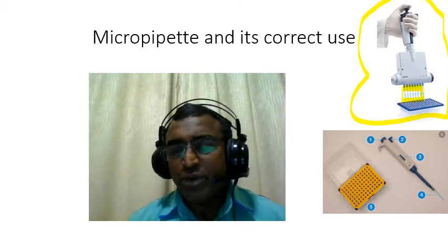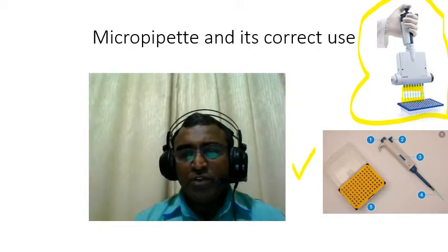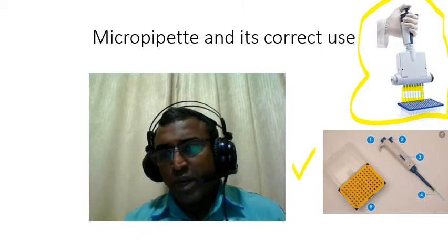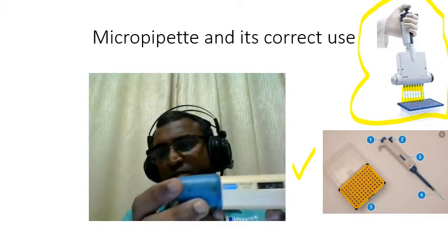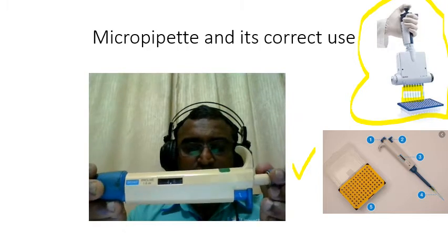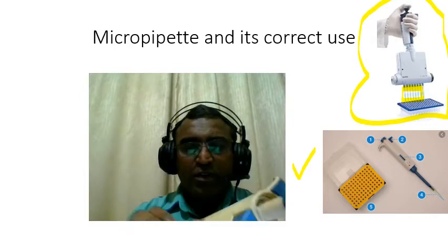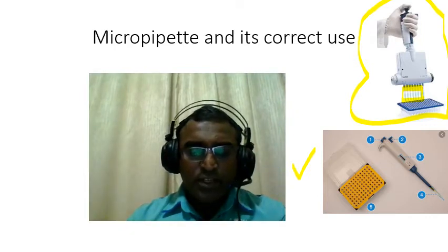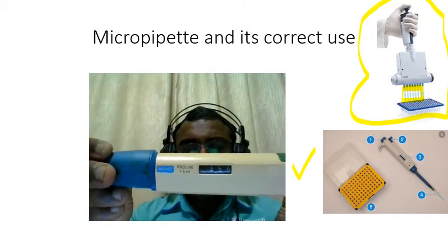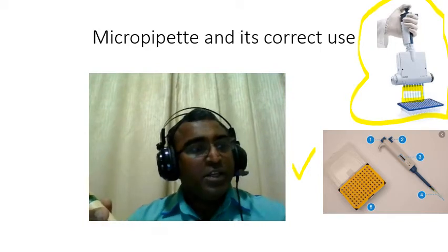You also have a photo here with the numbering 1, 2, 3, 4, and 5. Just to explain, I will explain number 1 and 3. This is the way to adjust the number, whatever volume that you want. So say if I want 4.5 ml, I just adjust it. You can hear the clicking sound, okay? And therefore it should read 4.5 there, and then I can start putting in the tips.